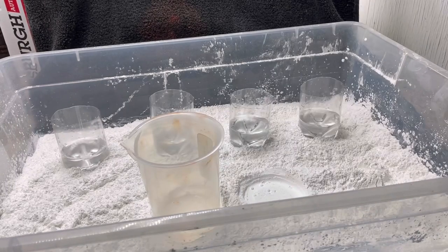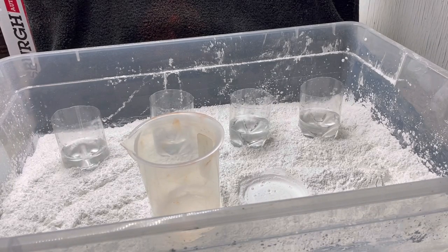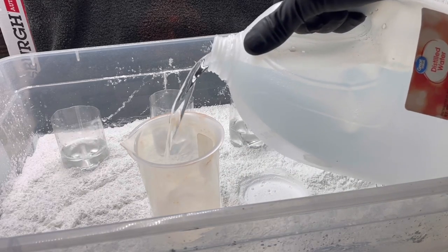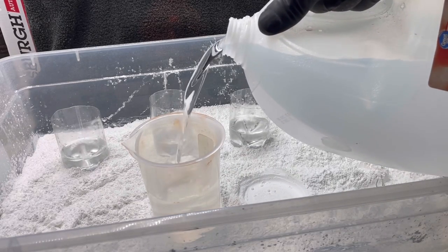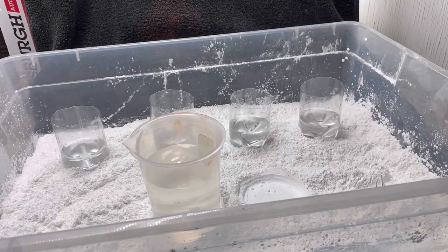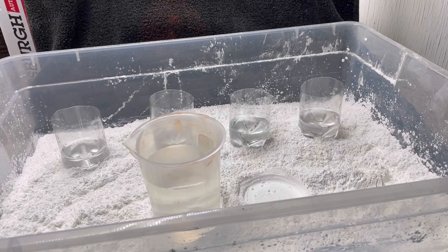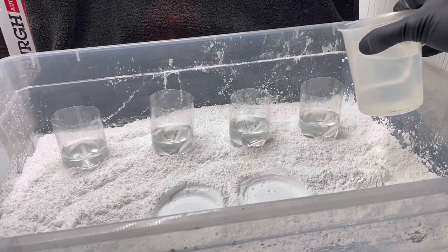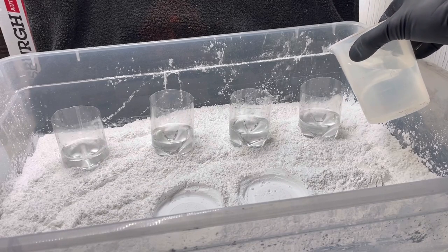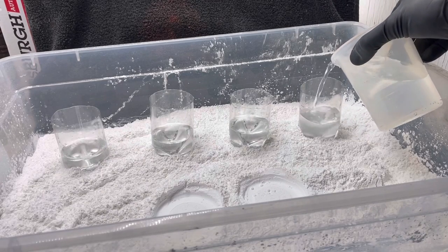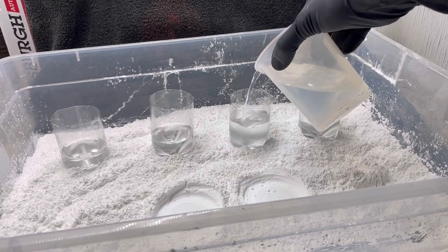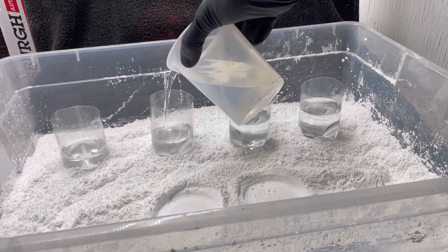Okay, I'm actually going to dilute the acid about 50% with distilled water. So let's make an acid about 20% concentration. I'm mostly doing that to save acid and to make the dissolution more efficient. Just so I don't have to use quite as much. I'm already using quite a lot.